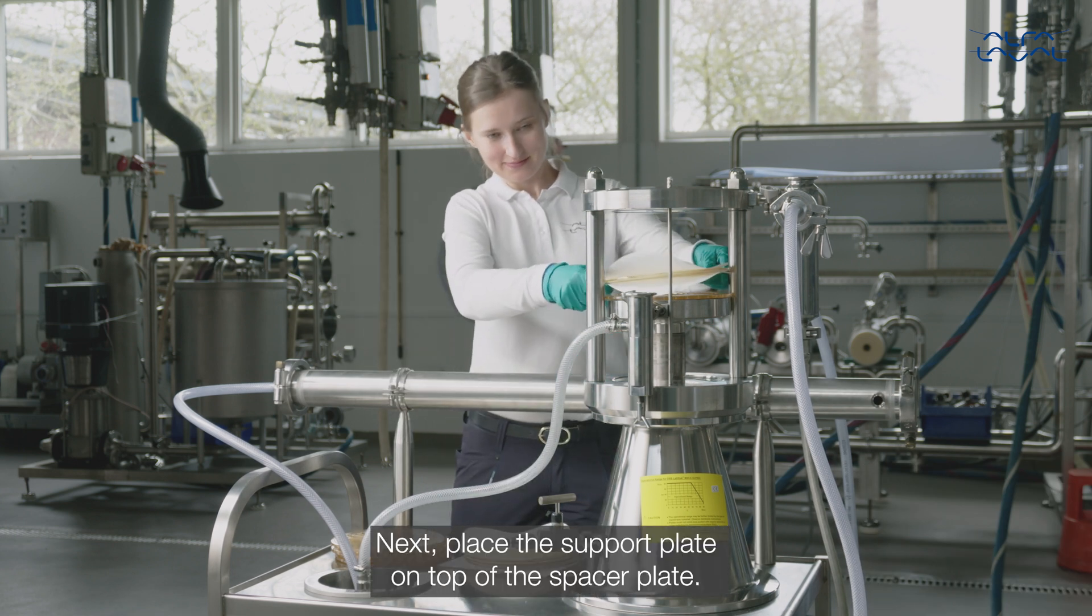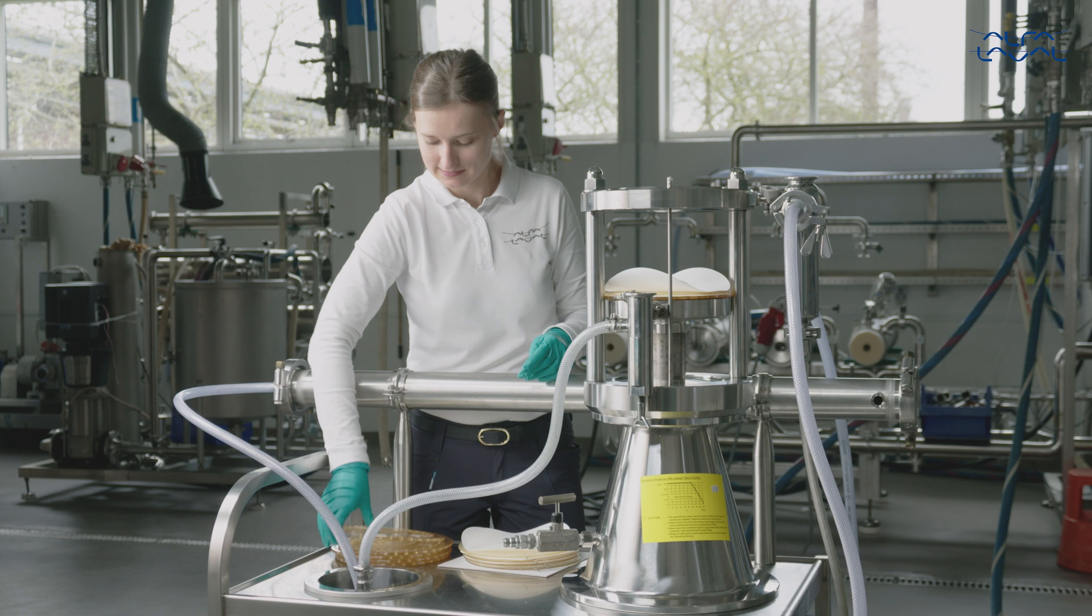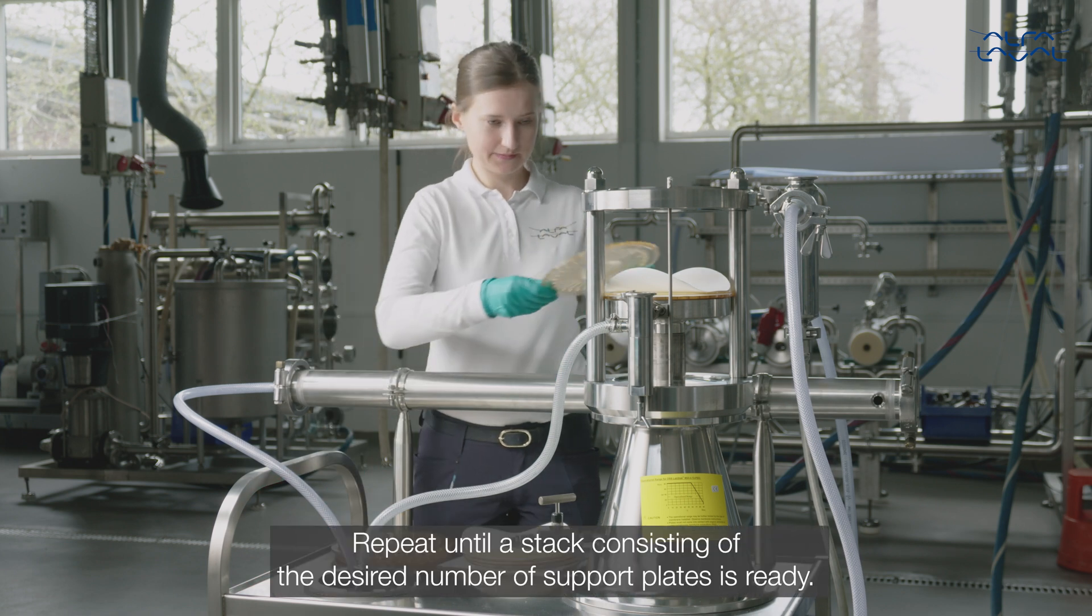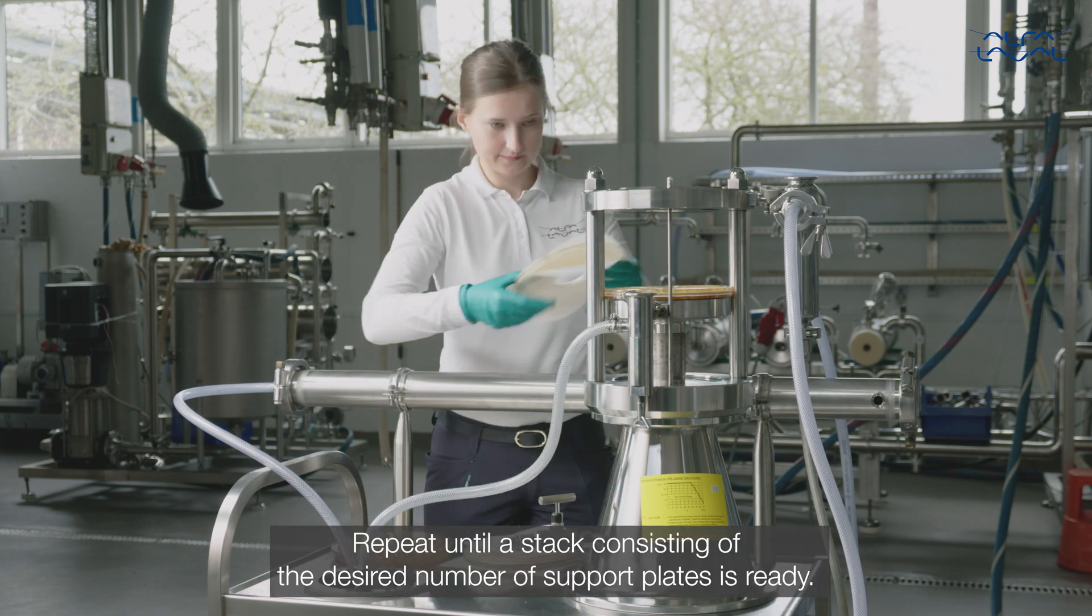Next, place the support plate on top of the spacer plate. Repeat until a stack consisting of the desired number of support plates is ready.